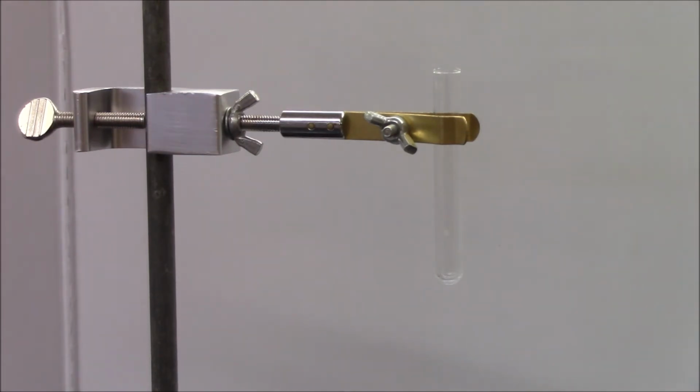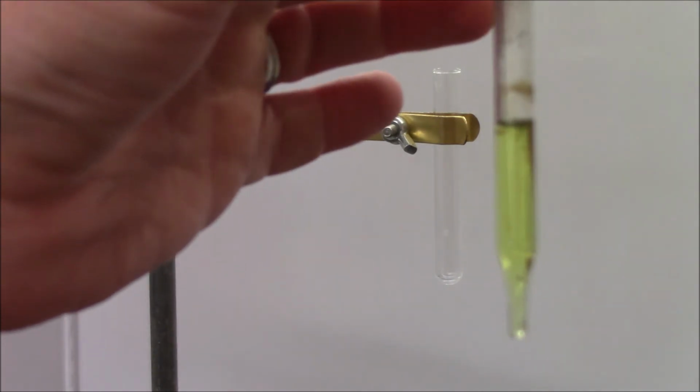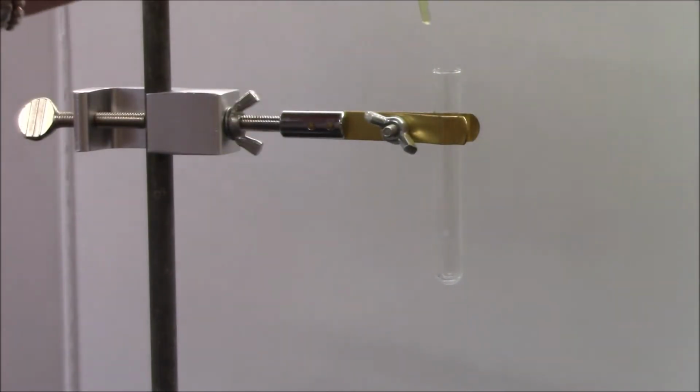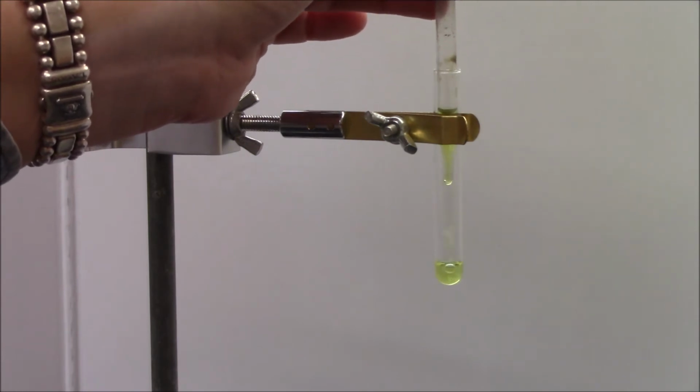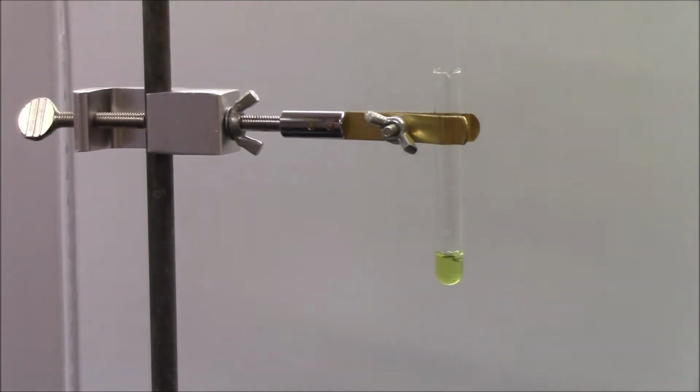In our next reaction, this is reaction 5, we're going to add iron 3 chloride ions. Okay, so I'm going to use a different looking dropper. I'll bring it up to the screen for you. But you can see this is transparent, but it has a yellow-orange color. It should. Yep, that's what I thought. I don't understand why it's not working.